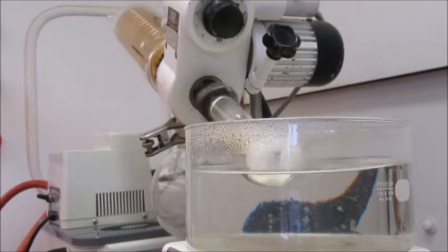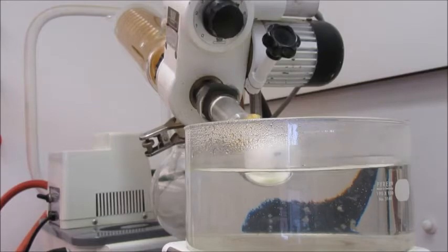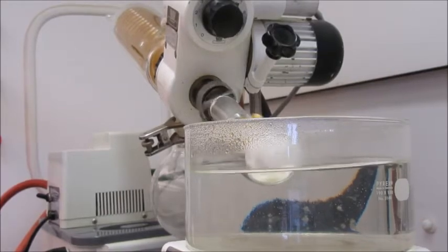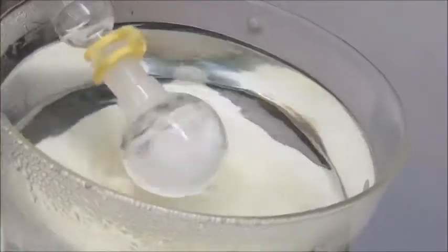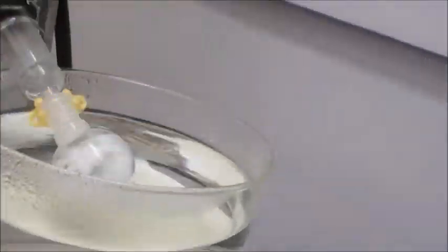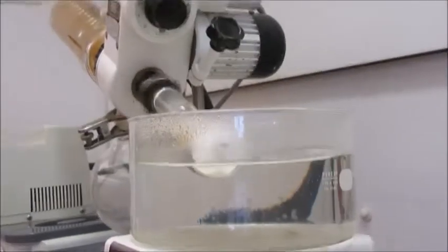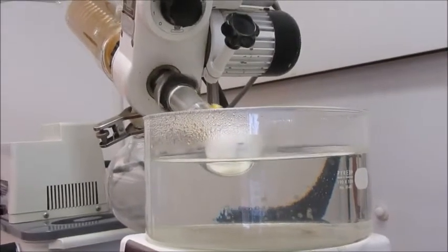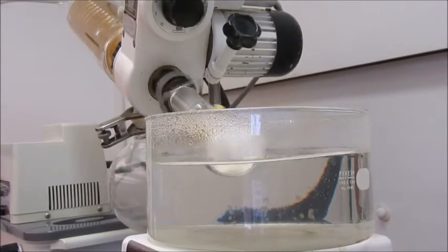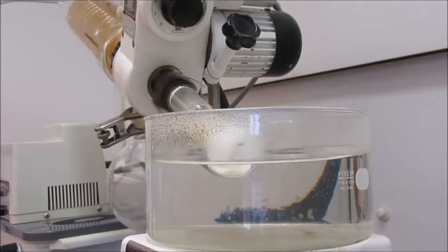Okay, so now you can perhaps see we have the light solid. That is our final camphor product, and I'm going to take that off the rotary evaporator now.